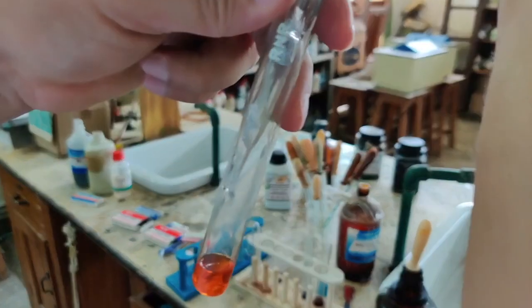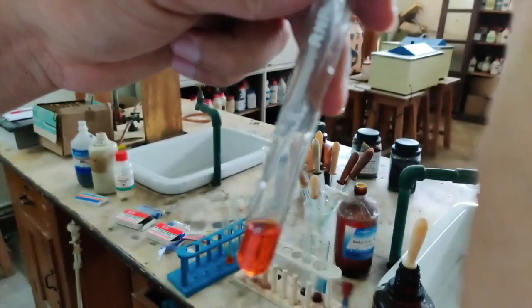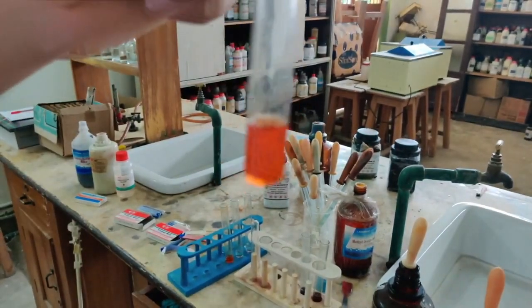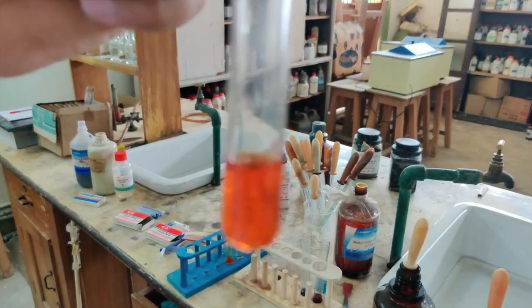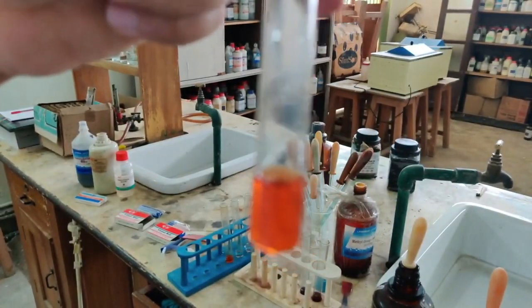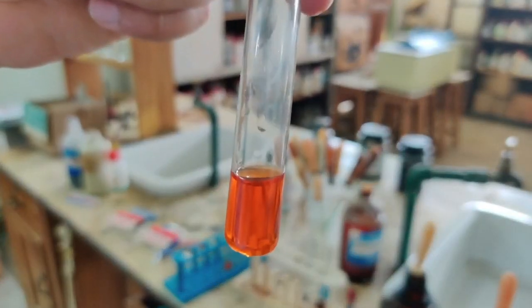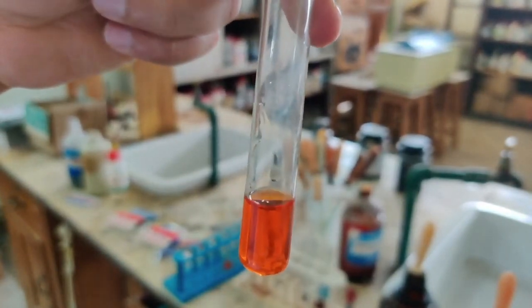Here it is. Now if I am adding dilute hydrochloric acid, you can see it has changed the color. So the color change which has taken place has slightly become different from what it was before. Previously it was yellow. Now you know it has slightly become pink in color. So let me autofocus it, slightly pink in color. So this is how your methyl orange turns to pink in acidic solution.